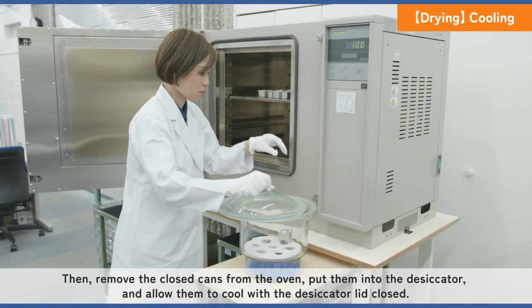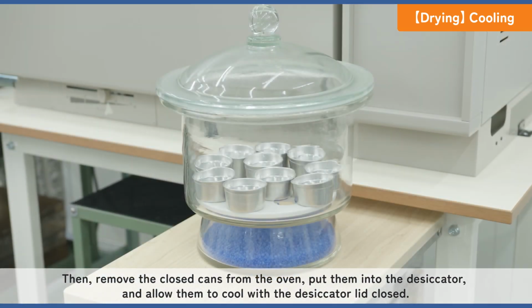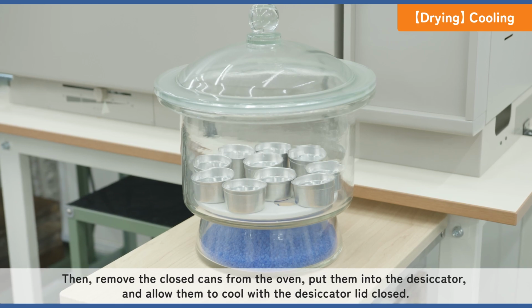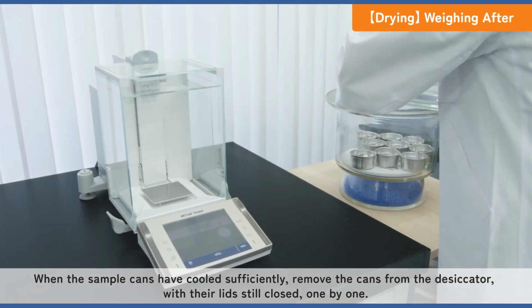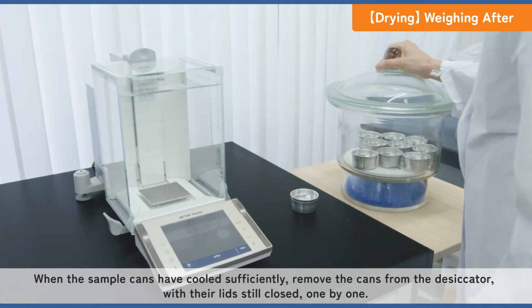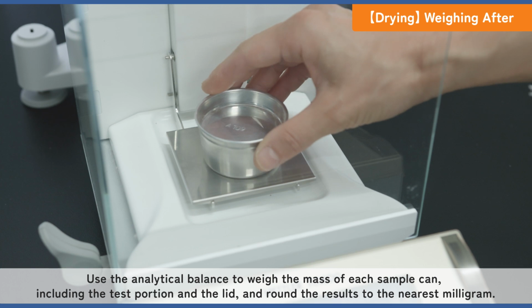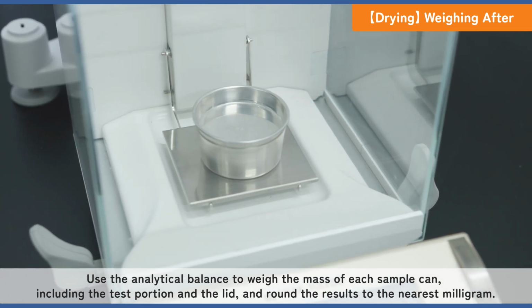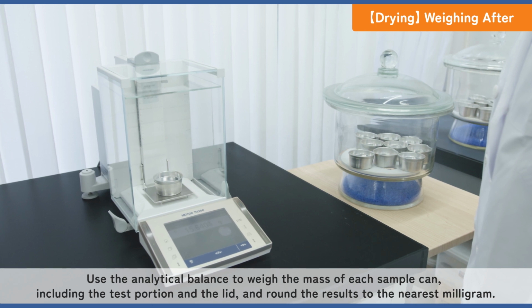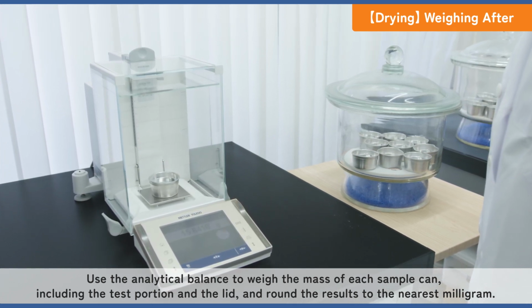Then, remove the closed cans from the oven, put them into the desiccator, and allow them to cool with the desiccator lid closed. When the sample cans have cooled sufficiently, remove the cans from the desiccator, with their lids still closed, one by one. Use the analytical balance to weigh the mass of each sample can, including the test portion and the lid, and round the results to the nearest milligram.